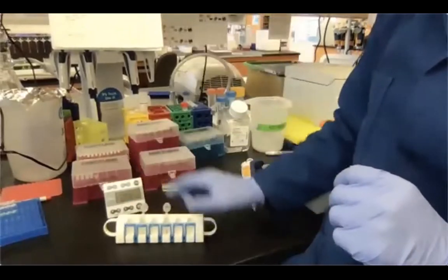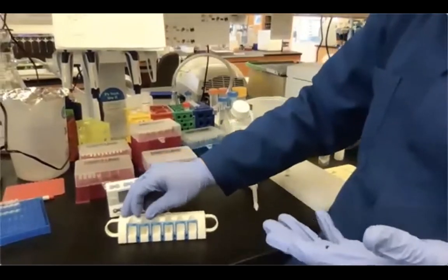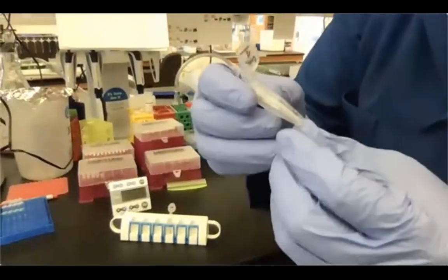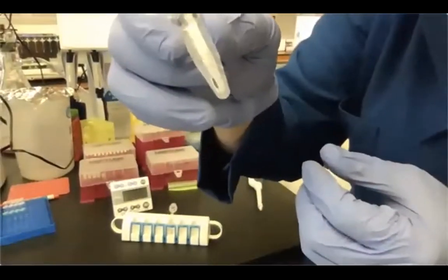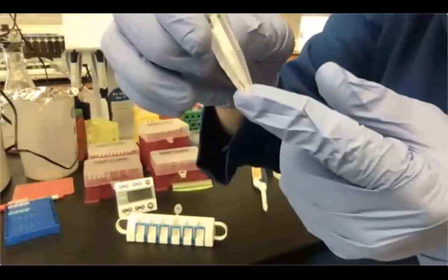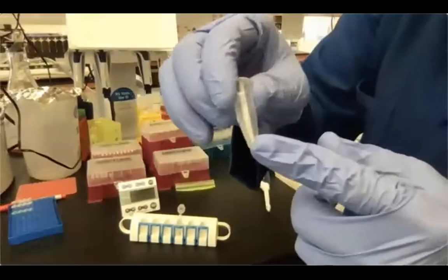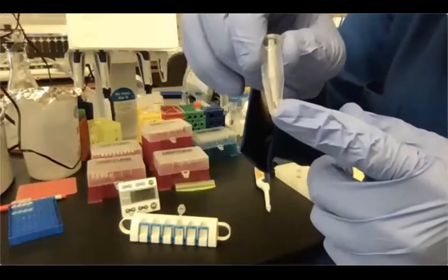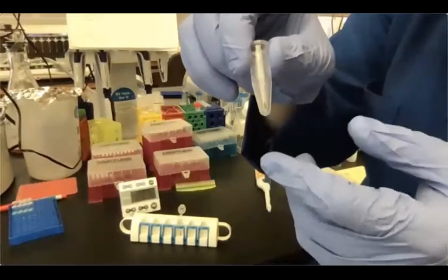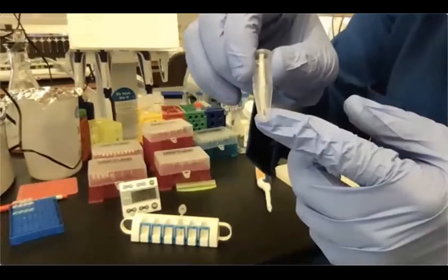And you can see that. So it's going to be pretty difficult to see for you. Now I can take it off because there's basically no liquid for the beads to be resuspended in. But you basically have to take a closer look at the bead pellet. I think it's pretty impossible to see from there. But if the bead pellet is glossy, it means that it still has ethanol, so you still have to wait. However, if the bead pellet is not glossy anymore, and it's, let's say, like a matte brown, it means that it's basically the perfect timing to resuspend it, okay?